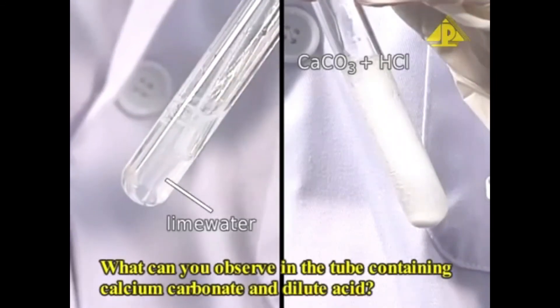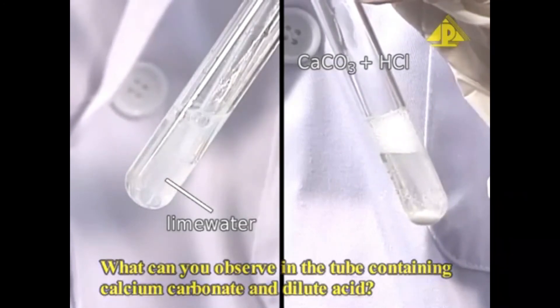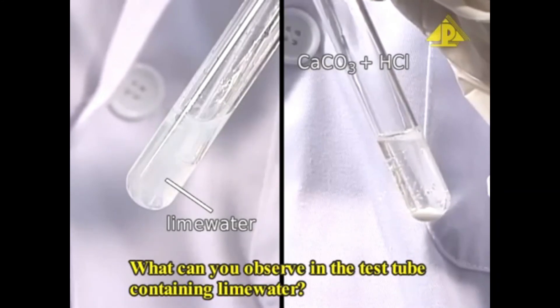What can you observe in the tube containing calcium carbonate and dilute acid? What can you observe in the test tube containing lime water?